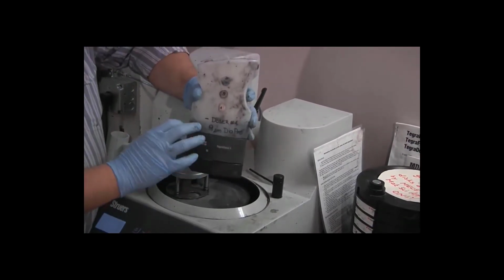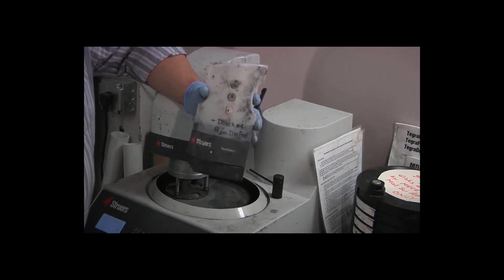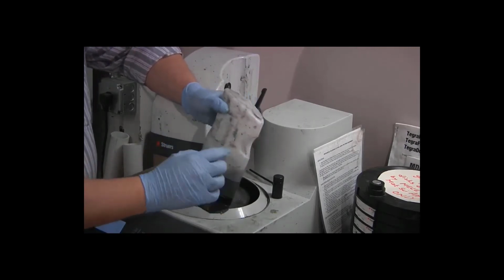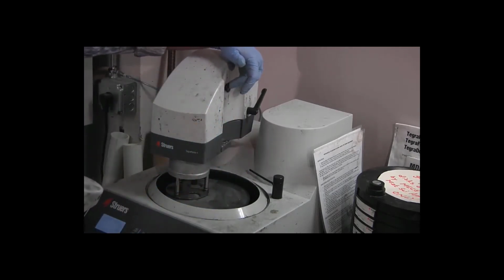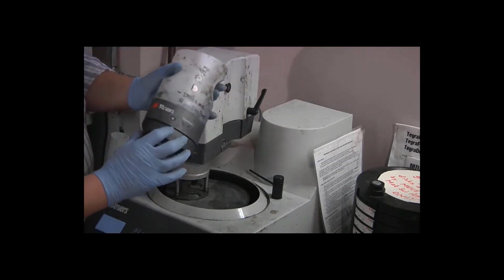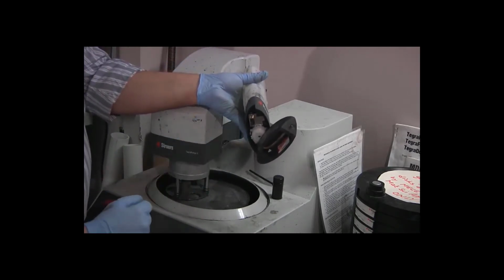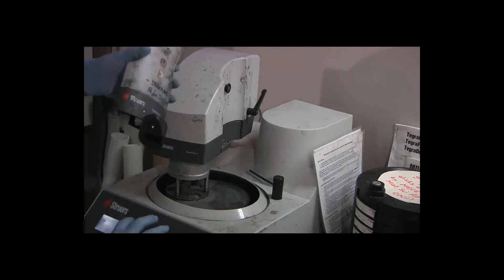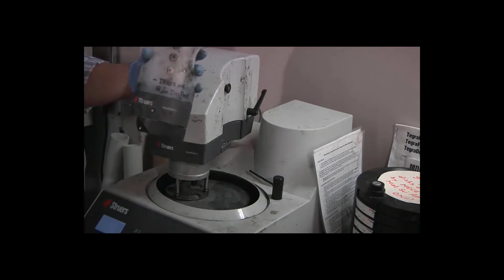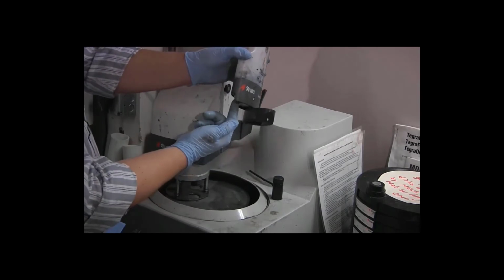So this bottle contains a gray liquid that has artificial diamond particles in it that on average have a diameter of 9 microns. On the back of the bottle there's a recess that fits onto this knob on the right hand side of the specimen mover head. If I swing the bottom of the dosing bottle out of the way, you can see there's an electronic connector here that fits into a matching one on the doser head. And that allows the base of the unit to control the dosing mechanism inside the bottle. So I swing the bottom out to the right to expose that connector.